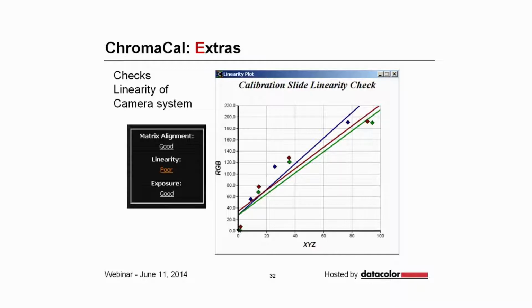There are some extras with the system. It does check for the linearity of your camera system. And by system, I mean not just the camera itself, which very likely is linear, but also some of the settings that you might set in the camera acquisition software. In this instance, the software will show you that the linearity is poor and actually won't let you proceed. And in the graph that you see to the right, you can see that some of the color values are scattered above the linear lines, showing that there was a change in gamma.